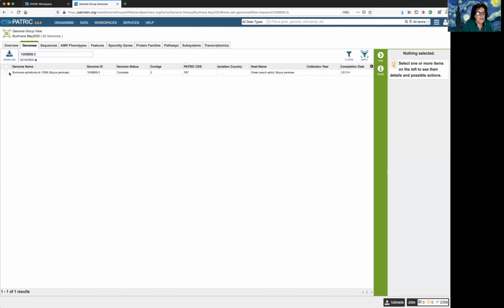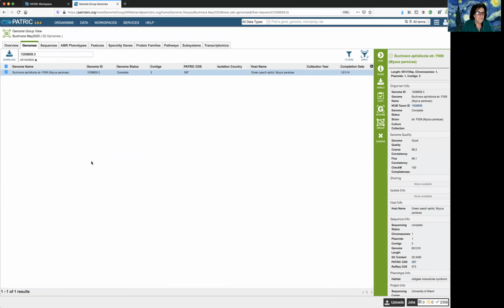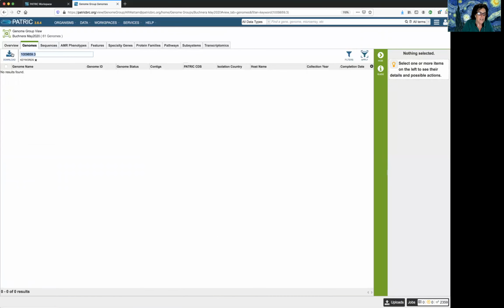Hit return. This guy is also gone, although I guess it's sexist because, or is it sexist? Bacteria don't have any sex, but to associate a genome I want to get rid of as male is probably not the best thing to do. I'll try to not even be anthropomorphic about my genomes. And then the last one, I'm assuming it's Buchnera, because those were the most. I could search for it in the tree, but let's go to this genomes group thing again, seeing as we already have it open. And let's put it in.